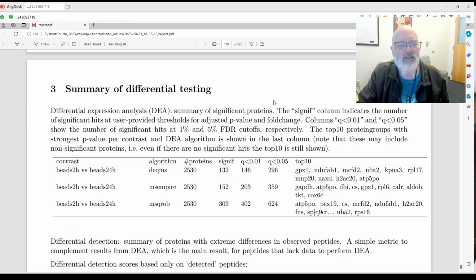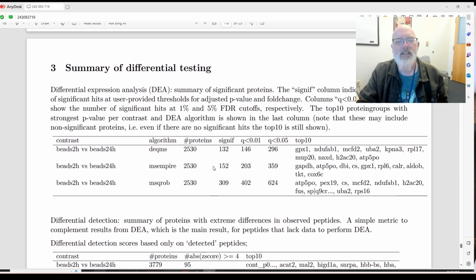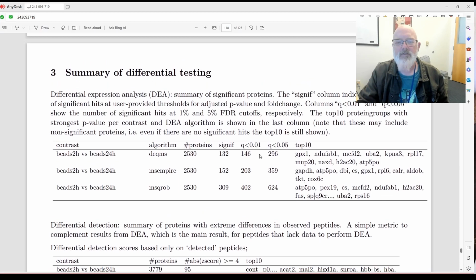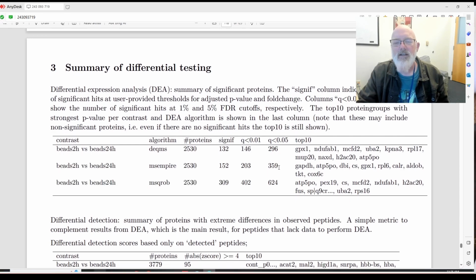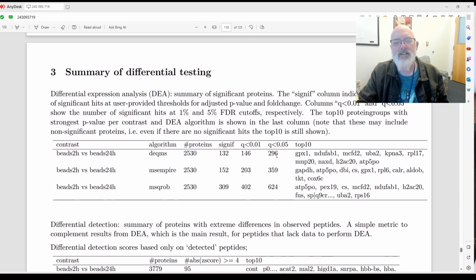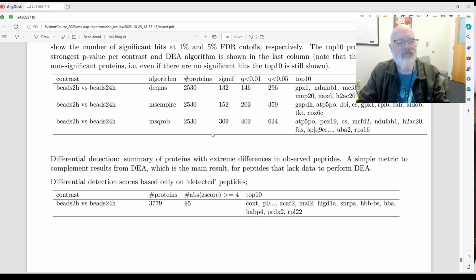The summary of differential testing. So this is kind of cool. These are the 3 algorithms: DEqMS, MS-EmpiRe, and MSqRob. These are the number of proteins significantly different at 1% and 5%. Usually 5% is used for differential expression. So anyway, you could see MSqRob was twice or 3 times more sensitive than DEqMS, and I don't exactly know why. We'll have to go back and read about that.